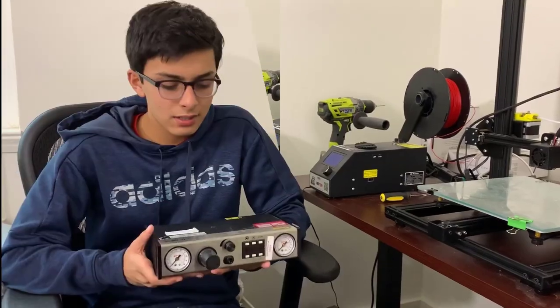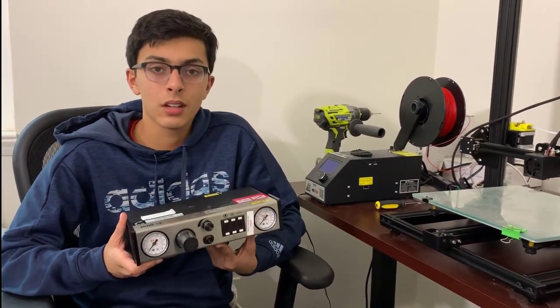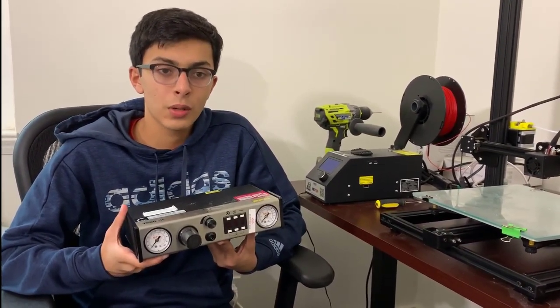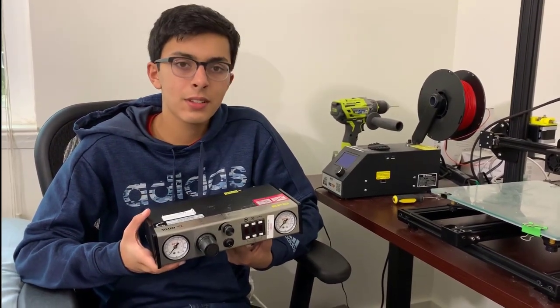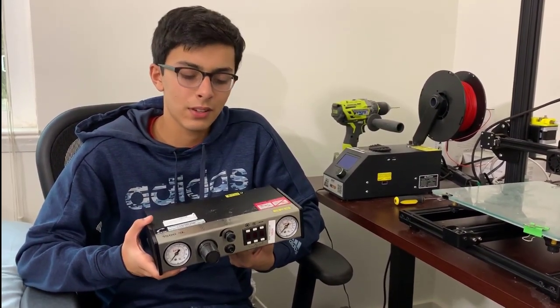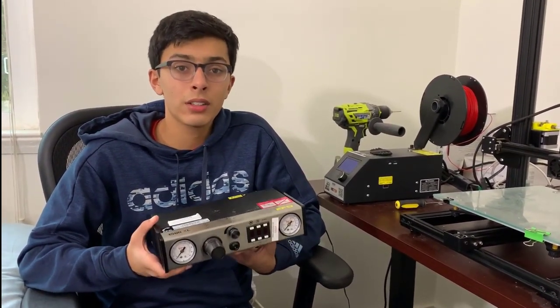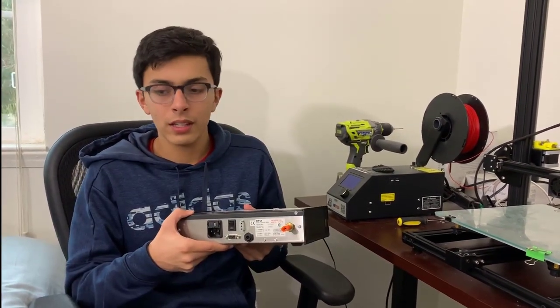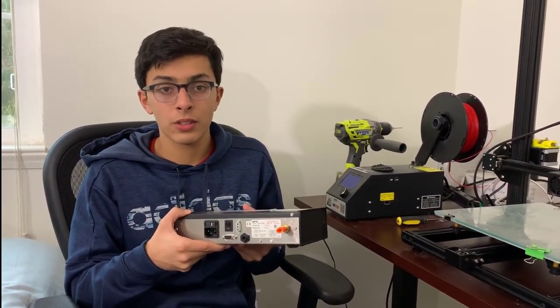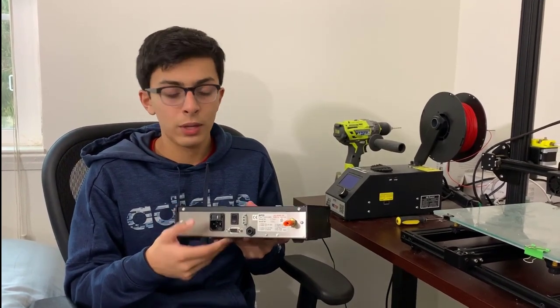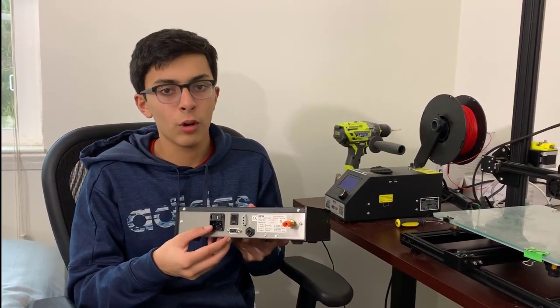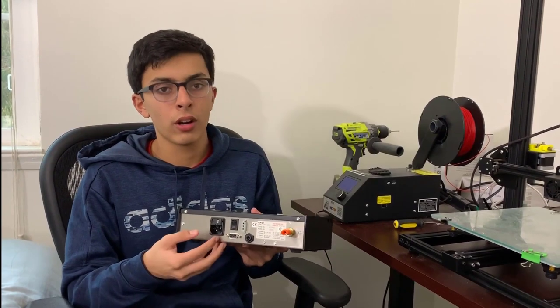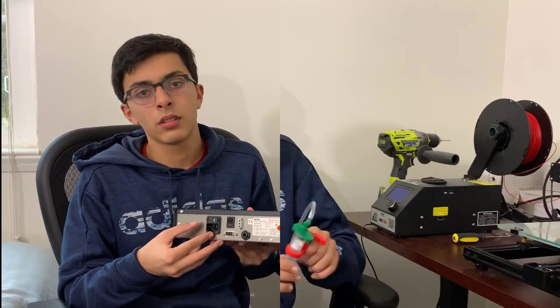Next is one of the most important components, the EFD dispenser, which is typically used to extrude adhesive materials. It has a sophisticated electrical valve inside of it that opens and closes when electrical signals are applied to it. We will also be using the electrical signals from our 3D printer's extrusion system so that we can precisely control when the valve opens and closes and therefore control our extrusion system.